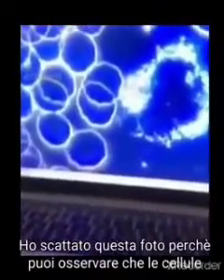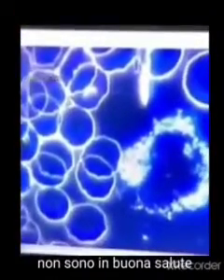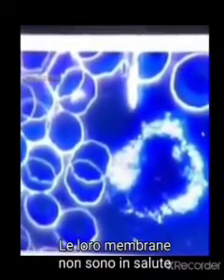Yeah. Right. I took this because you can actually see the cell surfaces here are really not healthy. So the cell membranes are not healthy. That's usually happening if there is some intoxication or something happening.